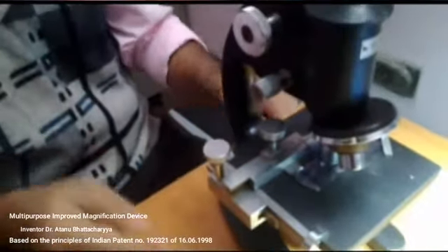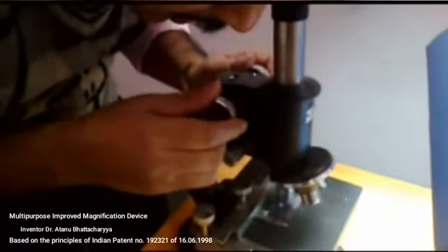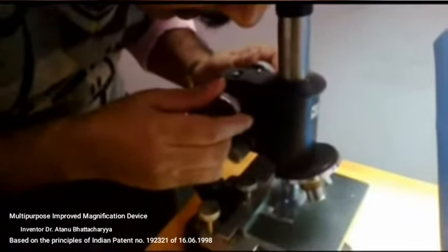Now I am using this device on the microscope. First, by this device I can magnify the image very much. For very high magnification we have to use the high power objective of the microscope. Here the 40x objective is used. So before using the device, at first the microscope has to be adjusted. Now I am adjusting the microscope, and the microscope has been adjusted.